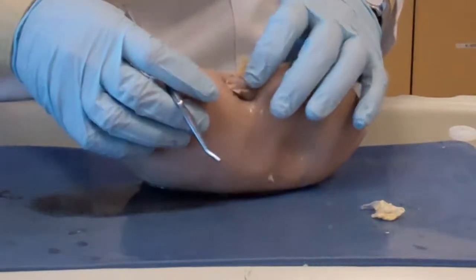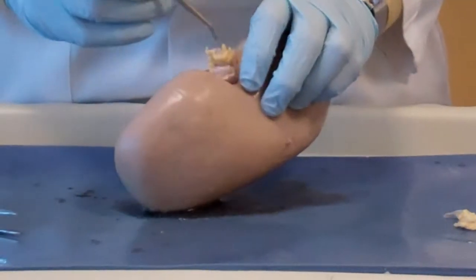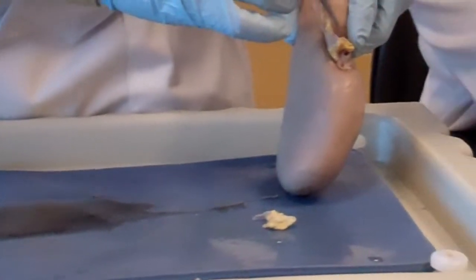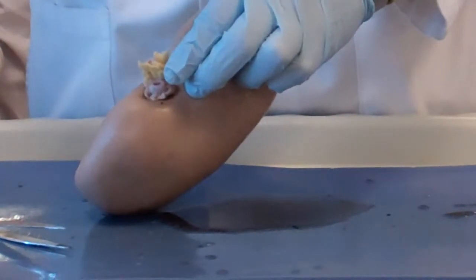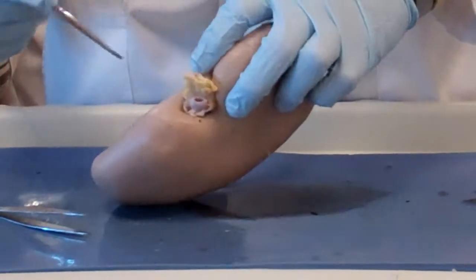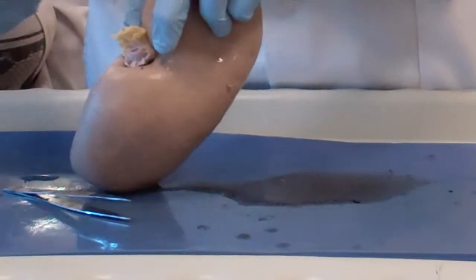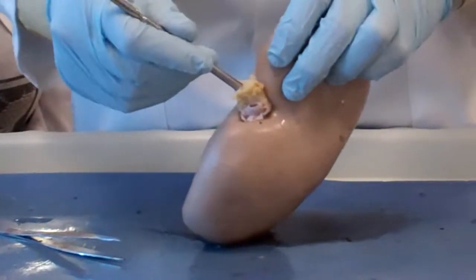Now, obviously, we need to see here some connective tissue, and we go out to see also if there is an artery and a vein, okay? So this is the vein, and you can see the renal vein, very clear. This is a thin wall, squished. You can squish it, you can squeeze it. It doesn't retain its shape, so this is the renal vein, that's taking the blood away from the kidney. So here's the renal vein.